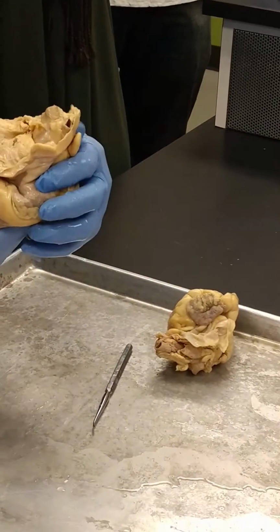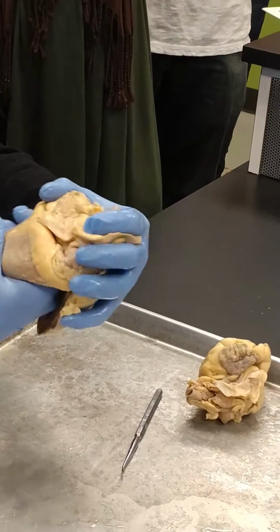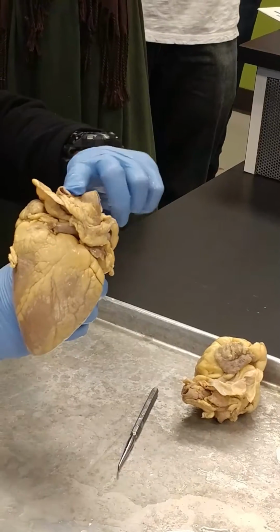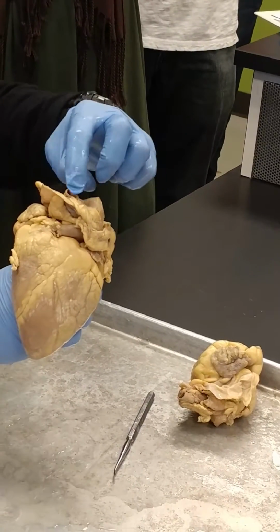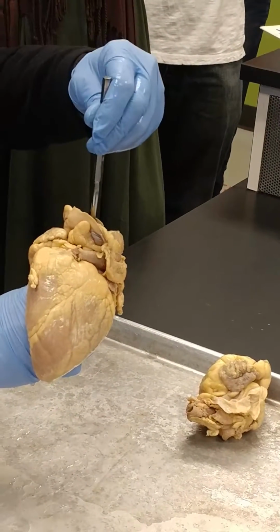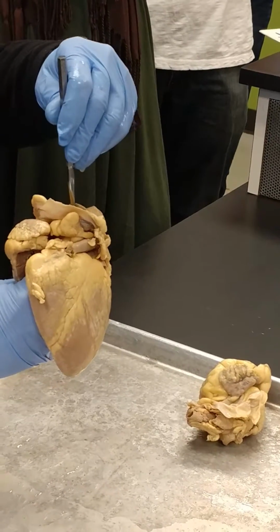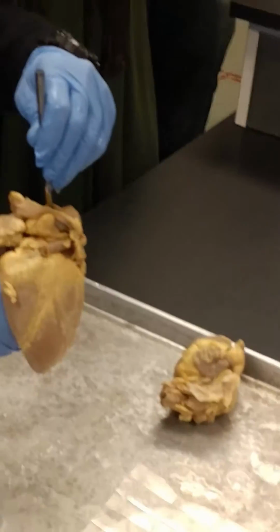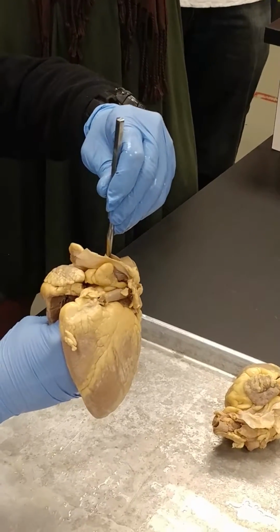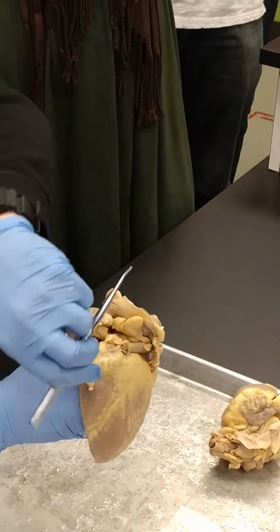And if you look at this, you can see there's the ascending aorta right here. If you look in, I'll stick my finger up a little further so you can see it. You can see my finger pointing out of the aortic arch. That's the aortic arch. And then this right here is what we call the brachiocephalic trunk. That's coming off of the aortic arch and going to the right side. Brachiocephalic means it's going to the arm and to the head, right? So we'll have the right common carotid coming off of this, as well as the subclavian going down into the arm.